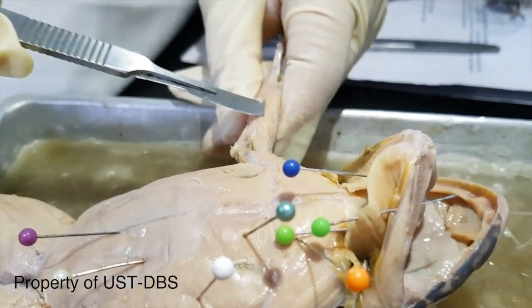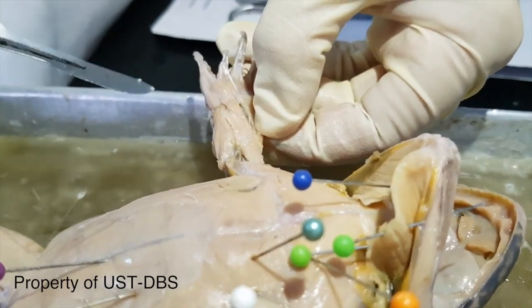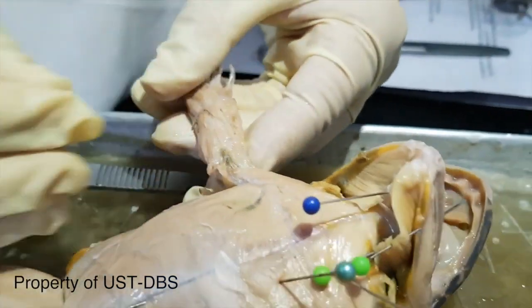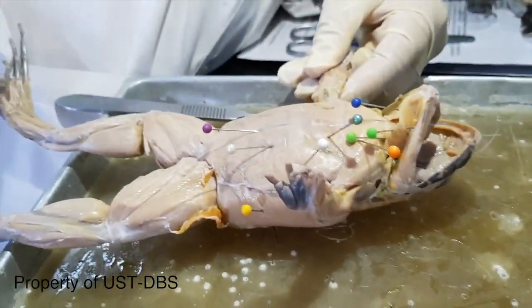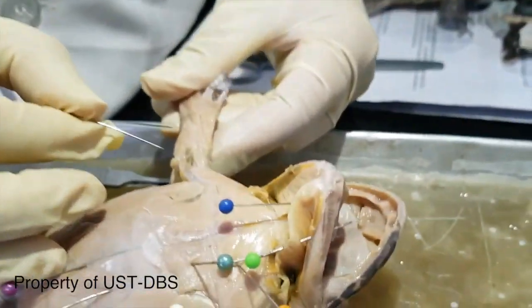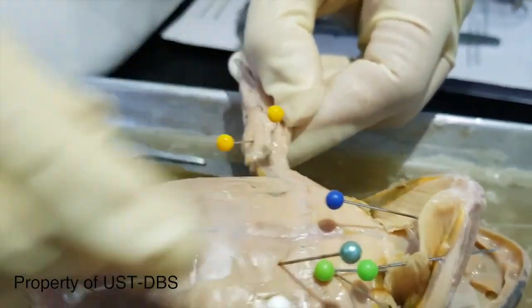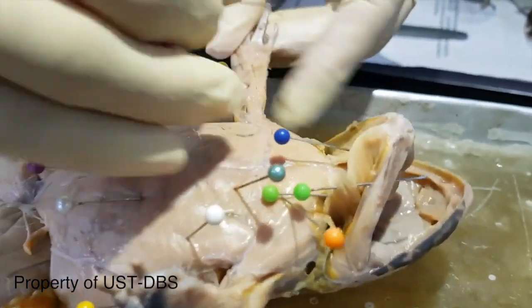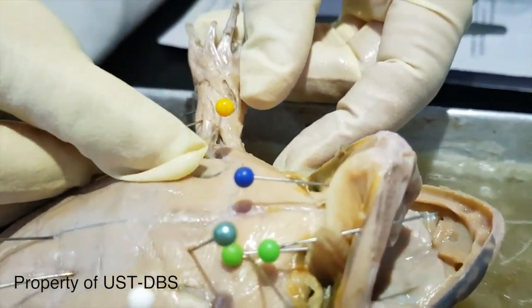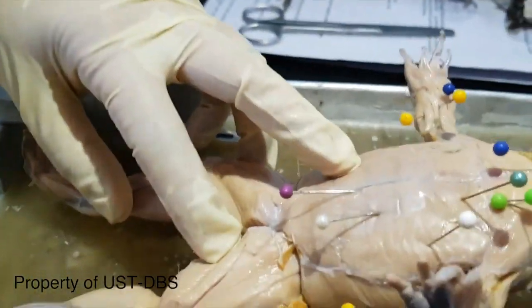Seen here is a very small muscle, but this is actually an extensor carpi radialis, which could also be seen here. So: flexor carpi ulnaris, flexor carpi radialis, and extensor carpi radialis. Okay, so three muscles for the arms.